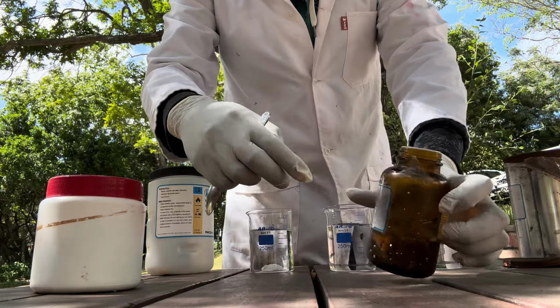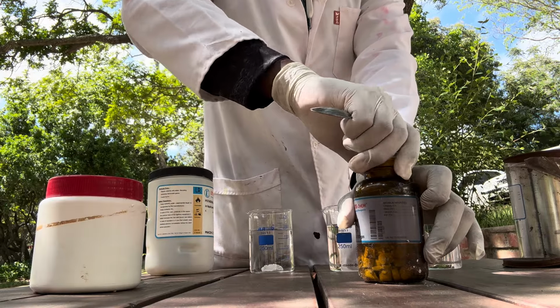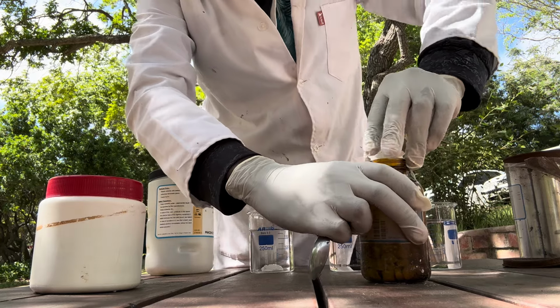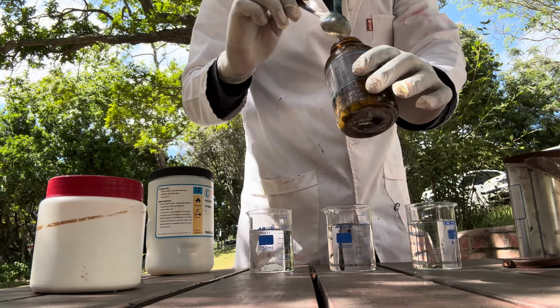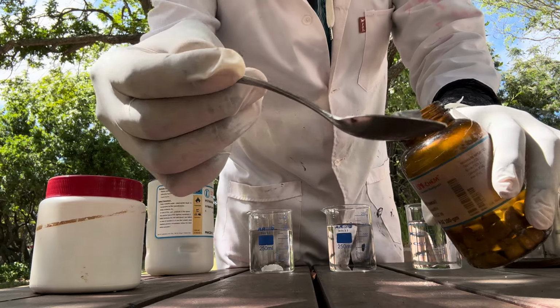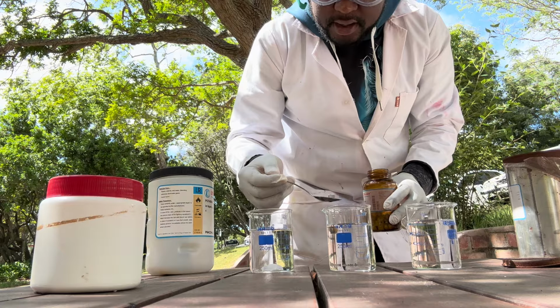Sodium, on the other hand, is kept in a solution of oil to make sure it does not react with air, because these substances do react with air as well. So let's see how this is gonna go. Just gonna grab one chunk of sodium in there. Again, you can observe it. It's a very white substance. It's a little bit oily right now because it just comes from oil. Let's drop it in.